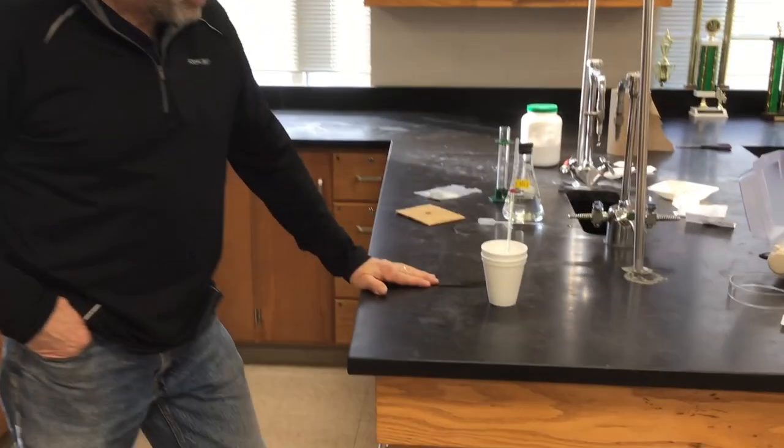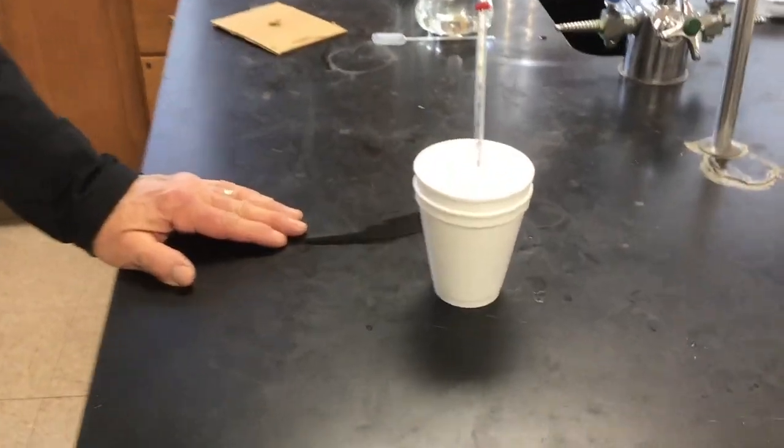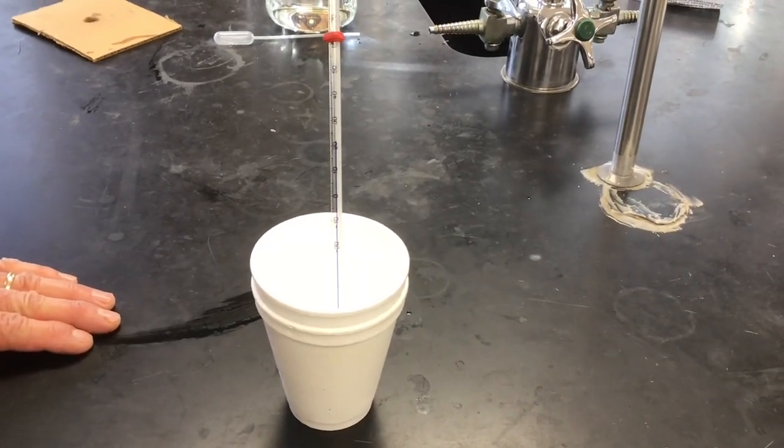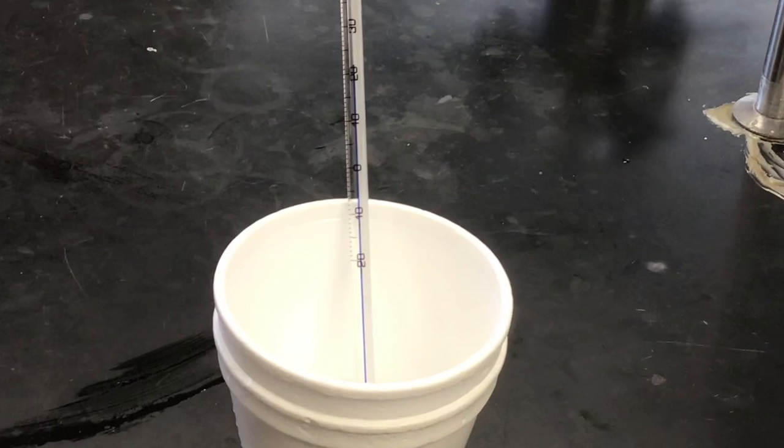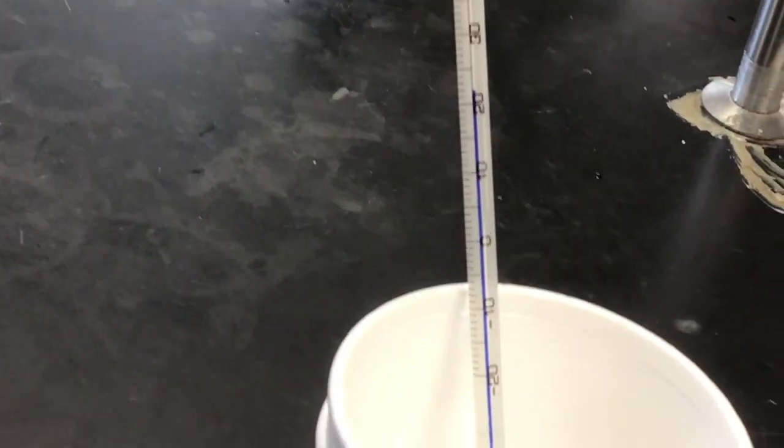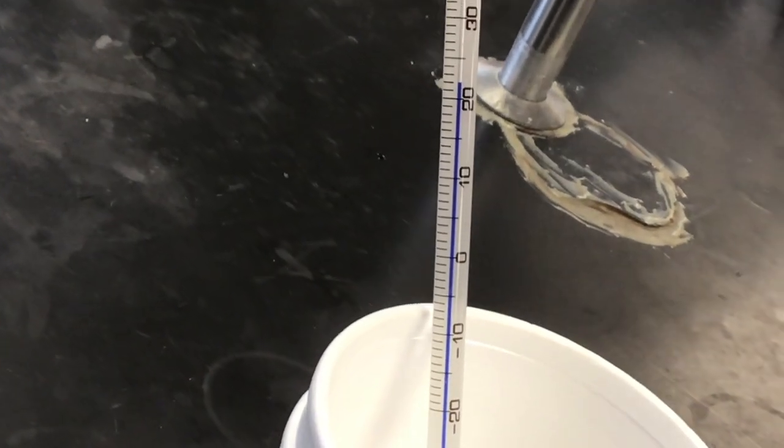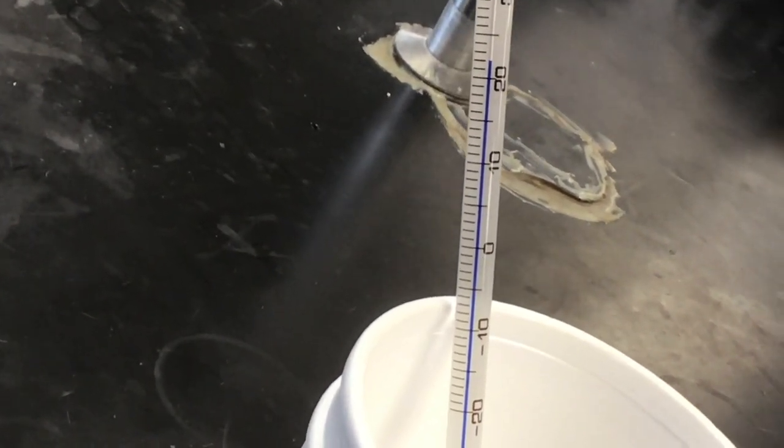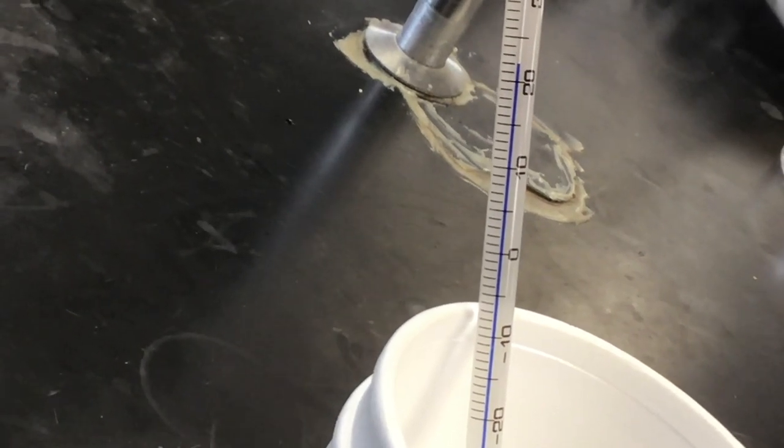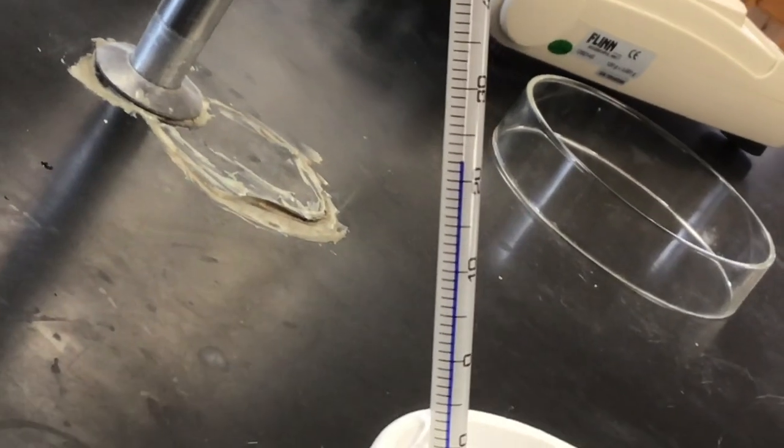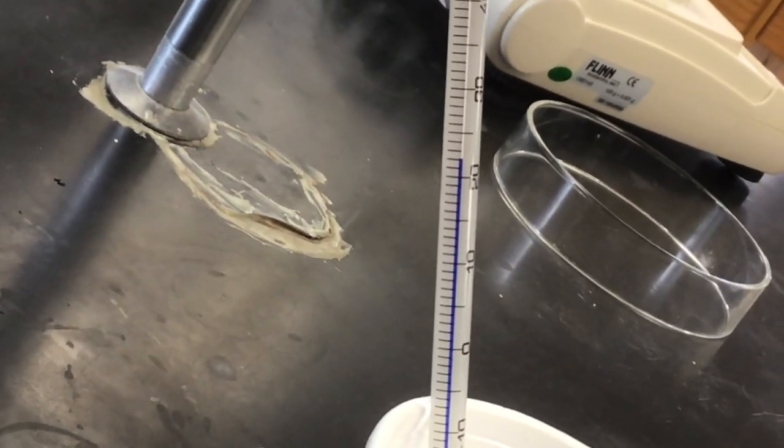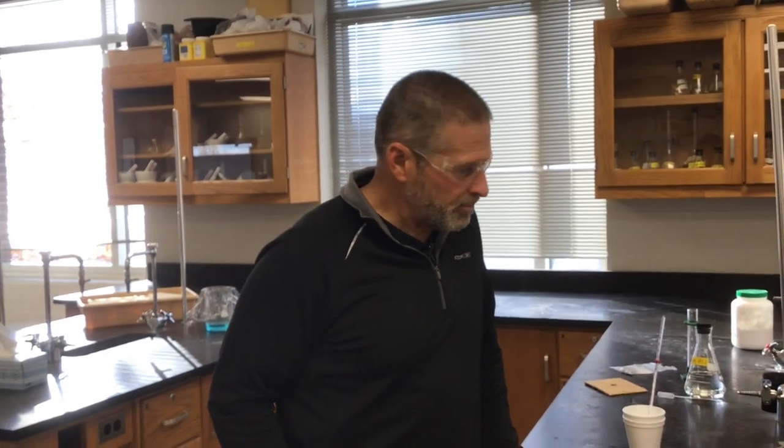After one of us dumped out the first trial of the magnesium oxide HCl mixture, we're doing a reset on that one. And so here is reaction two with magnesium oxide and hydrochloric acid. We have an initial temperature. This is where I went into my trouble last time. I tried to rotate the thermometer and bumped it and knocked it over. And by the way, that same volume for trial two is the same as it was in trial one. I'm using 50 milliliters.